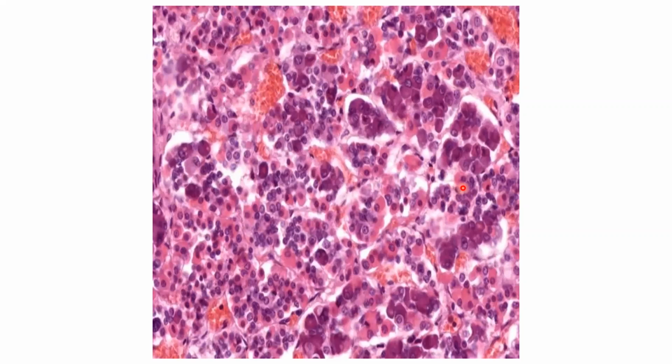So if you are getting a slide like this, what is the identification? This is the histological structure of a pituitary gland. Now, what are the identification points? The light staining acidophilic cells are there, and the dark violet staining basophilic cells are there. So this is the anterior pituitary. One identification is enough for you.